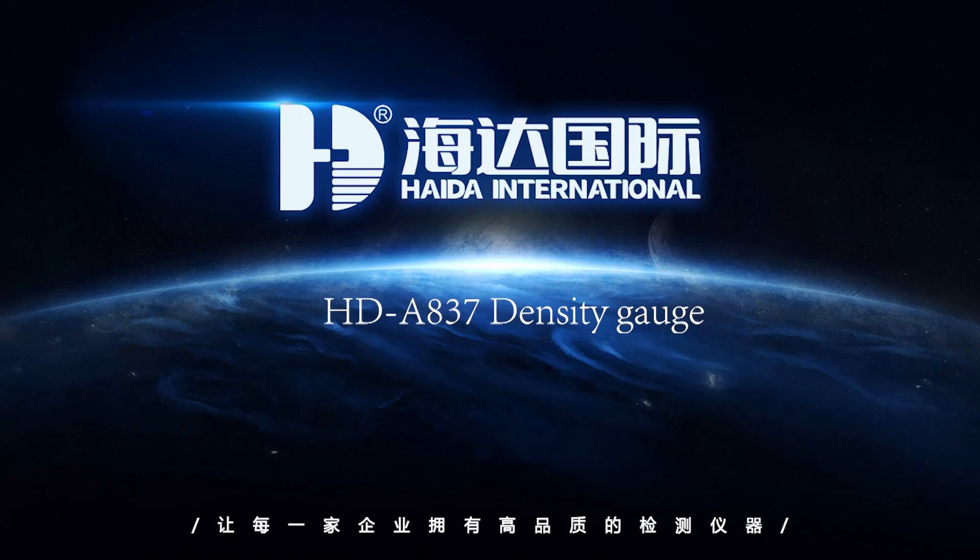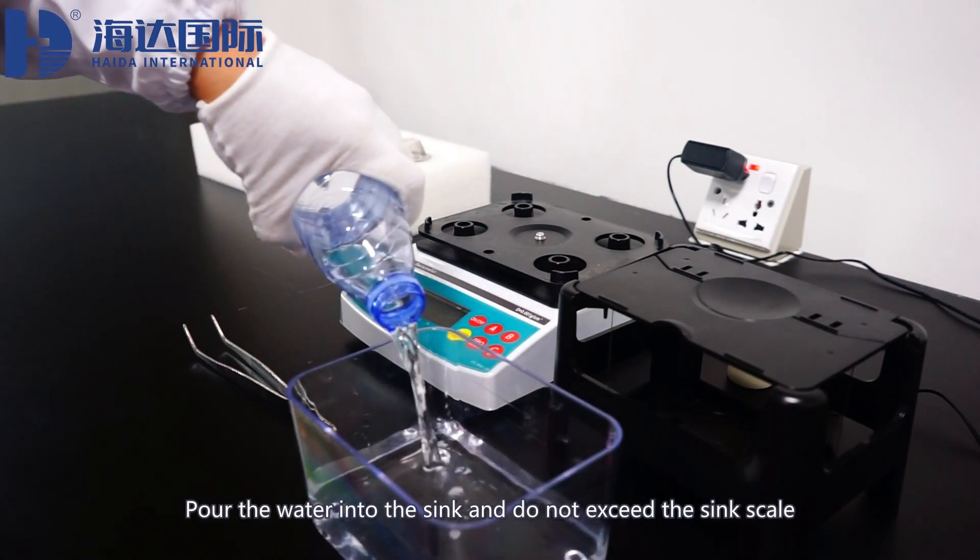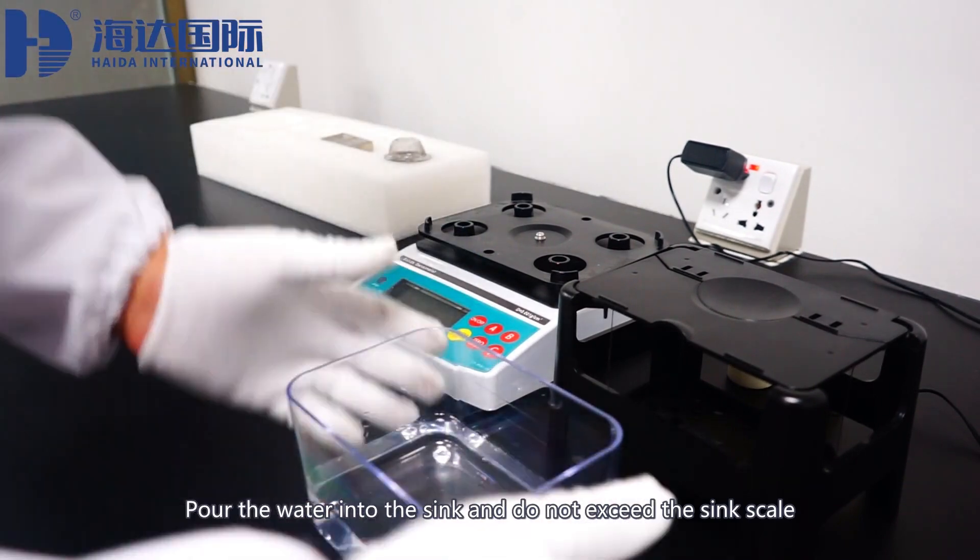HDA 837 Density Gauge. Pour the water into the sink and do not exceed the sink scale.